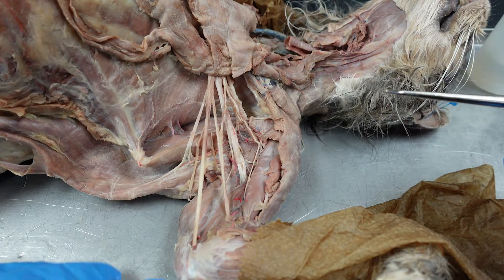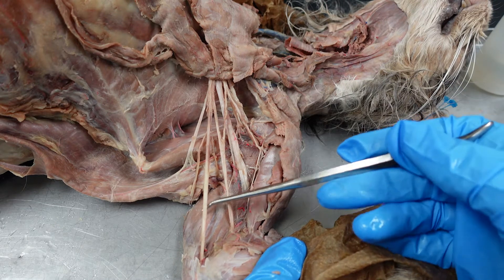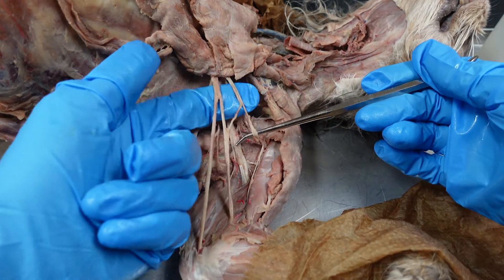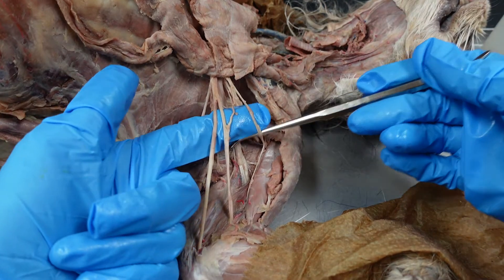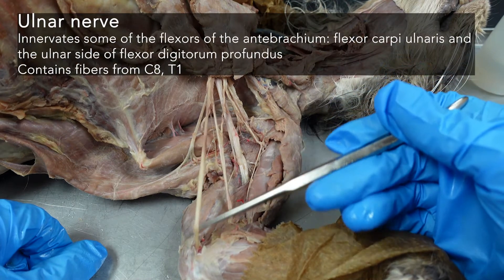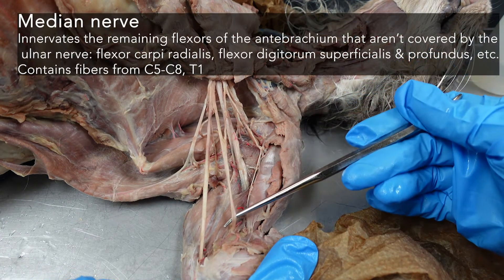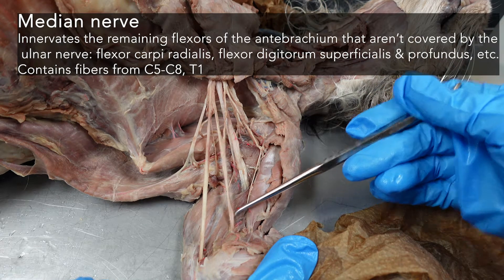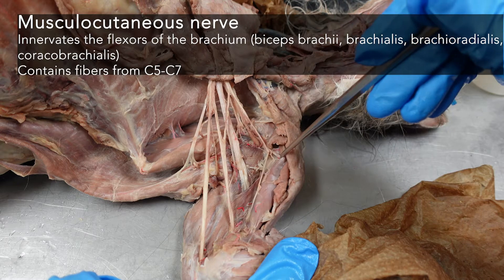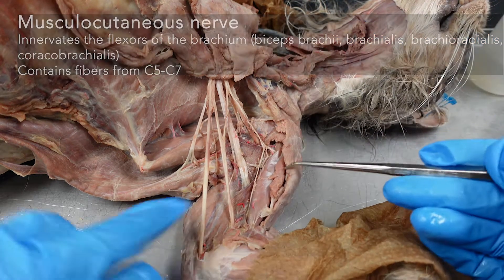At the cat brachial plexus, we just have a few differences in where some of the nerves are entering the tissue. We'll start with the nice M structure — you can really actually see the M structure here. We have the ulnar nerve, median nerve, and musculocutaneous nerve going down towards that biceps brachii and brachial flexors area.